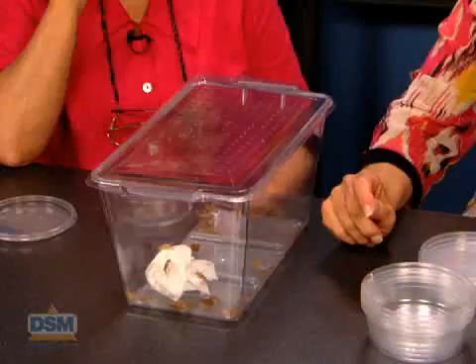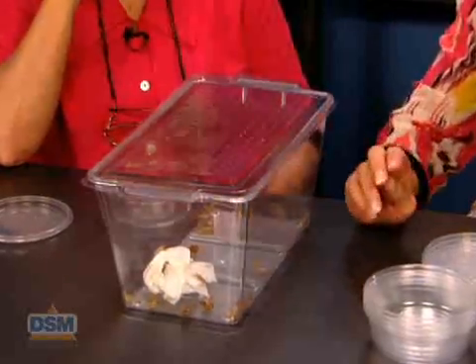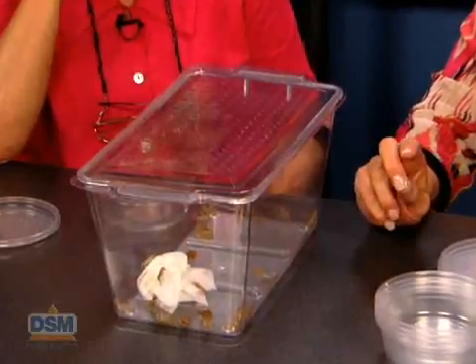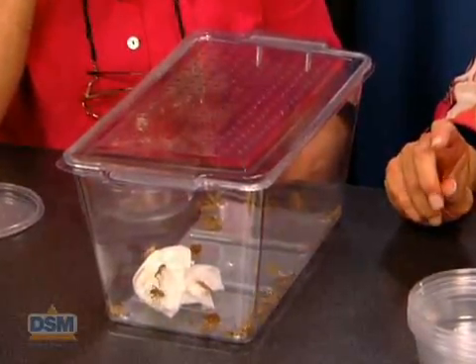Be sure to order the living materials shipment at least 4 weeks before beginning this activity. Your crickets will arrive in a box marked live materials. You will need to set up a temporary home for them in any plastic container with a lid and holes. Add some small pieces of potatoes for moisture and some bits of oatmeal for food. Add crumpled paper or egg carton material for them to hide in.